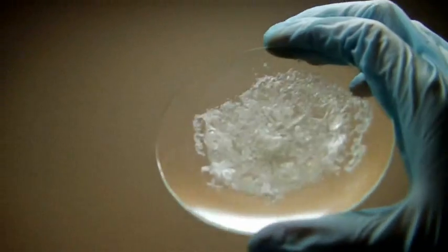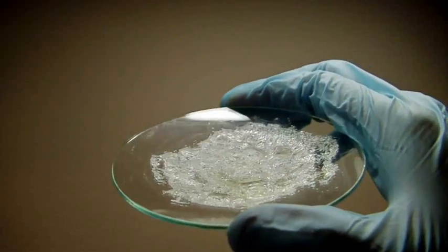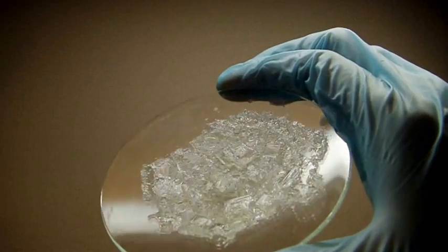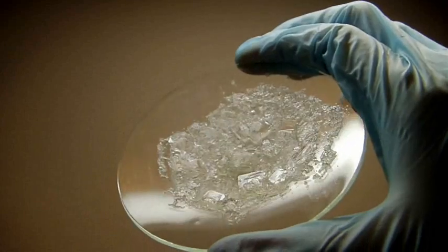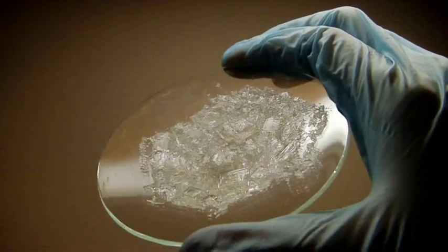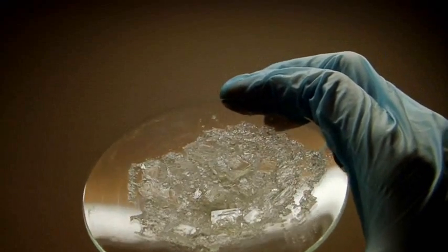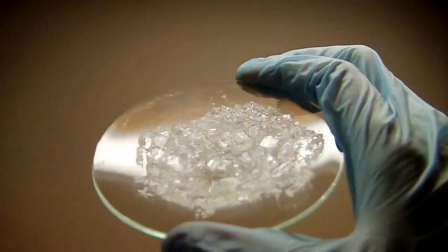And as I said, I boiled the solution to get that powder and I let the rest of it crystallize on its own. And here's the results of that, which came out to be really interesting actually. They're these really big square crystals, sort of like table salt. Probably because it's actually pretty similar to table salt. Regular salt is sodium chloride, so it's an alkali metal and a halogen. And it's the same thing for potassium iodide. So my guess would be that's where the similarities come from.